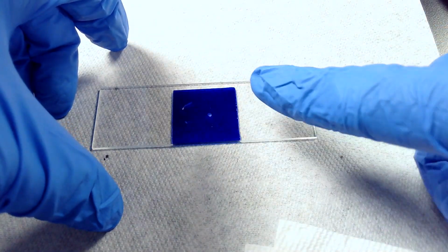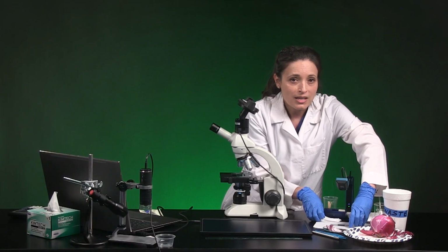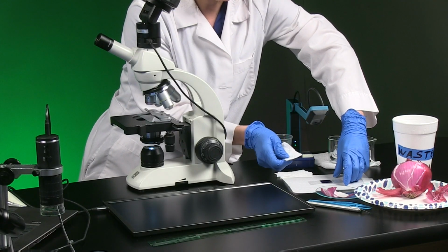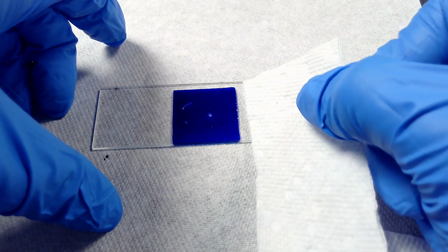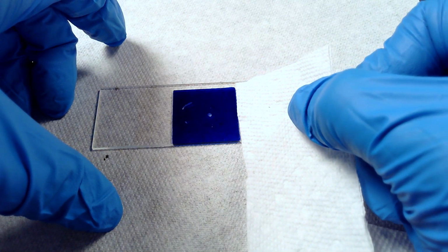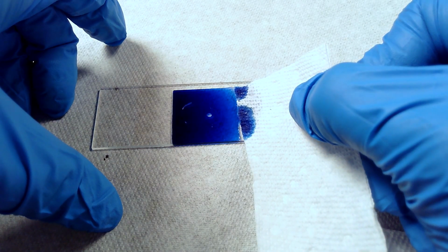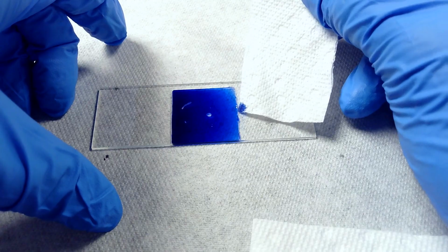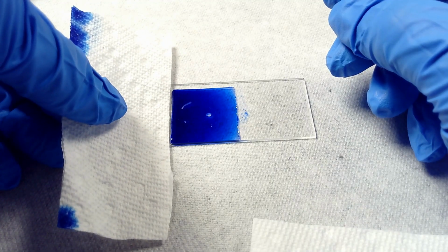You're supposed to let the stain spread over the area between the slide and cover slip on its own, and you should not push down on the cover slip. Use a piece of paper towel to draw excess liquid away from the cover slip without touching or pushing on the cover slip. Just a little bit there. And I got a little bit on the outside there. Okay, we go to the other side.